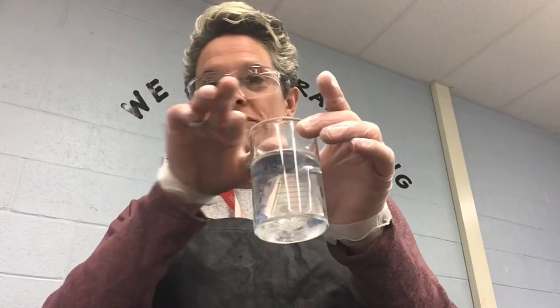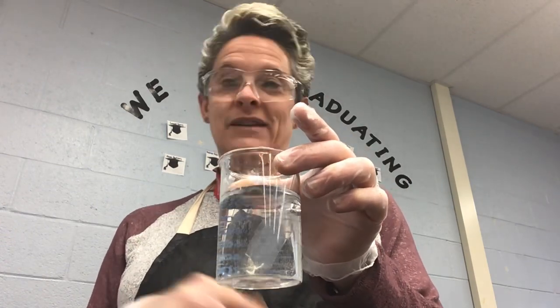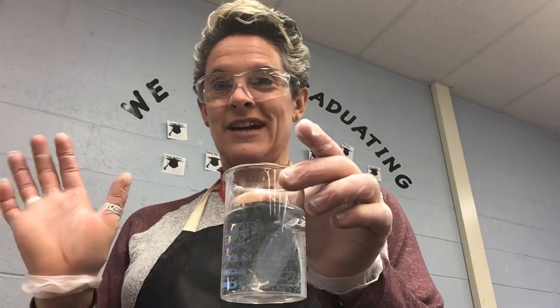Okay, so there it goes. We're just going to let it sit in there for 30 minutes. And I'll come back and show you part 2. All right, see you in a bit.